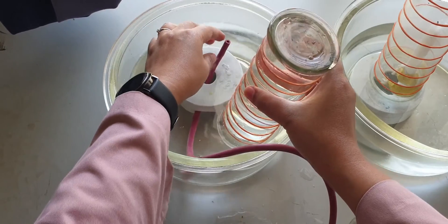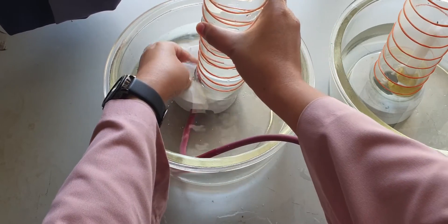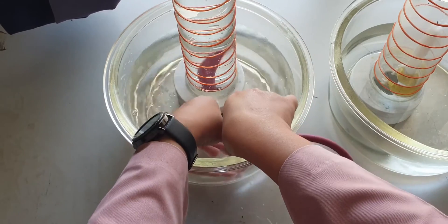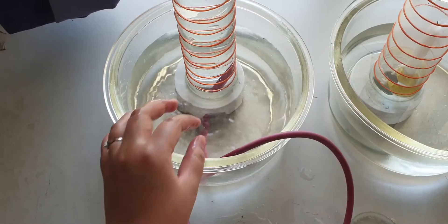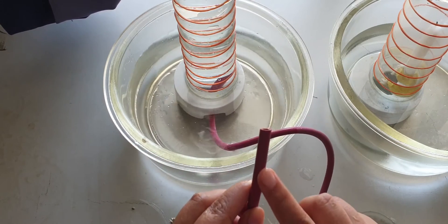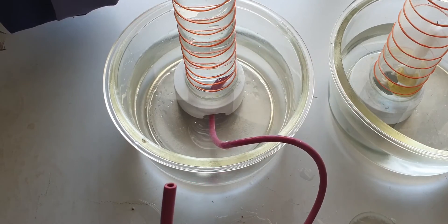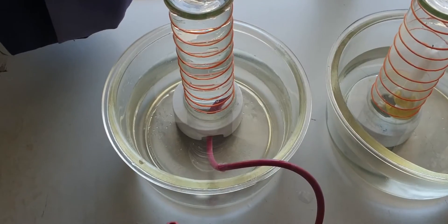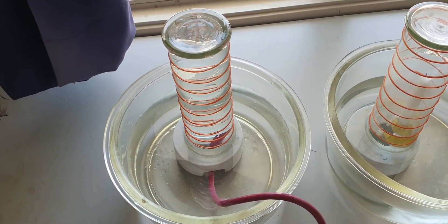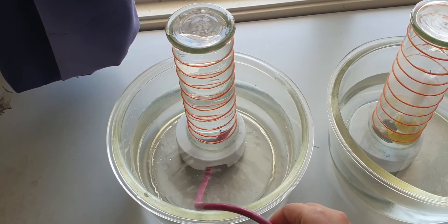And I will put it on top of the tube. What I'm going to do is blow exhaled air through the rubber tube, so the exhaled air will fill the gas jar. It's a water displacement method. The air that I blow in will displace the water out. So I'm just going to blow.